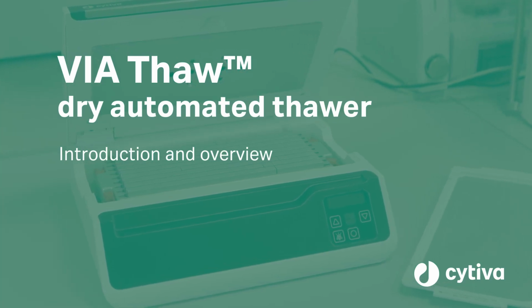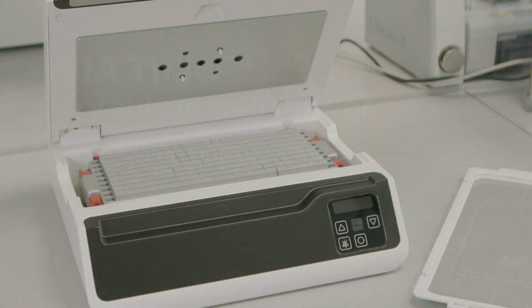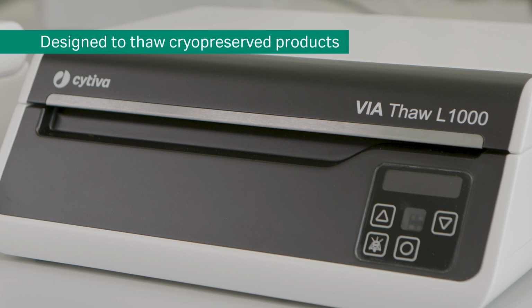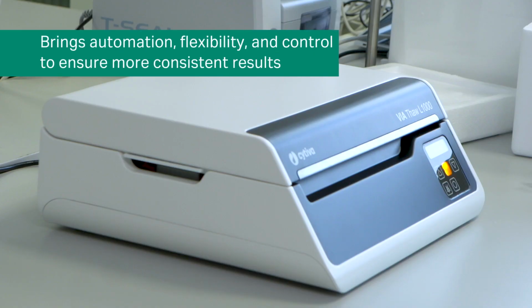Thaw instruments were designed to overcome challenges associated with using wet methods such as a water bath for thawing cryopreserved products. Thanks to advanced dry thawing technology, these instruments bring automation, flexibility, and control to the thawing process, delivering more consistent results.